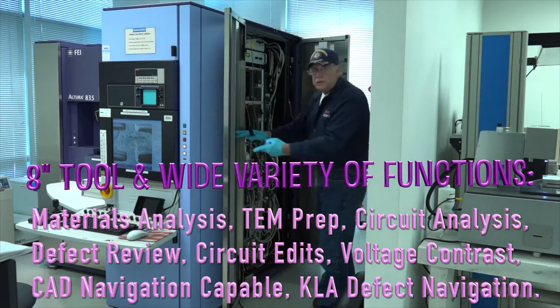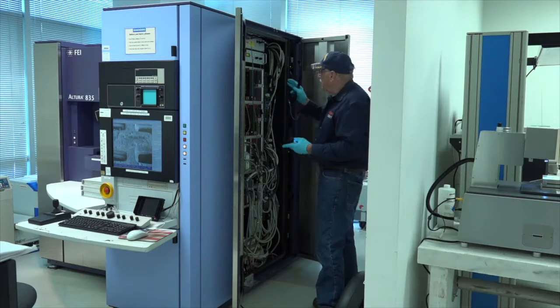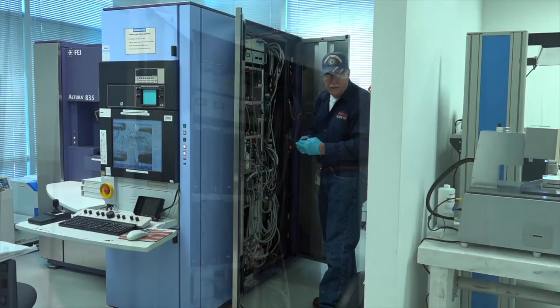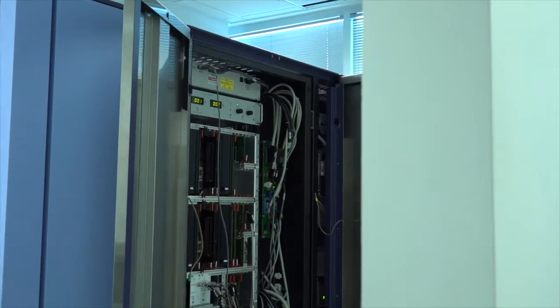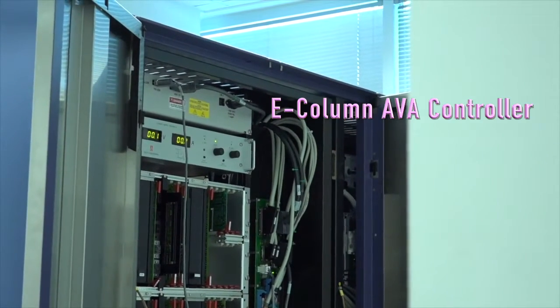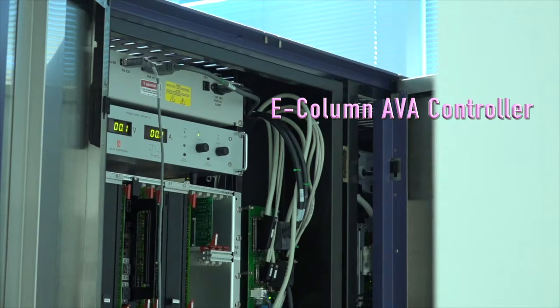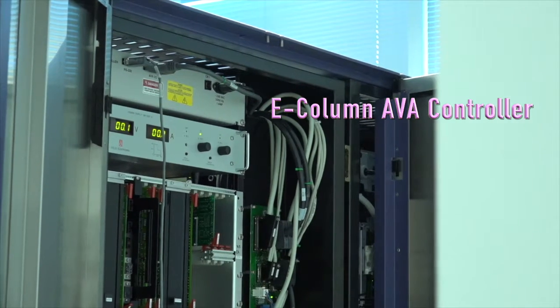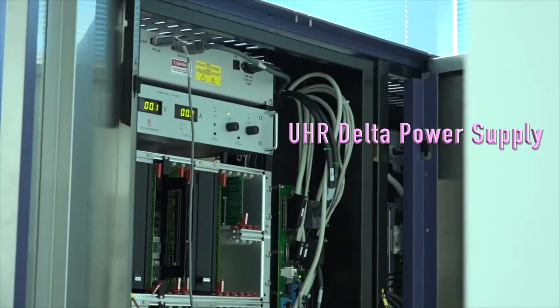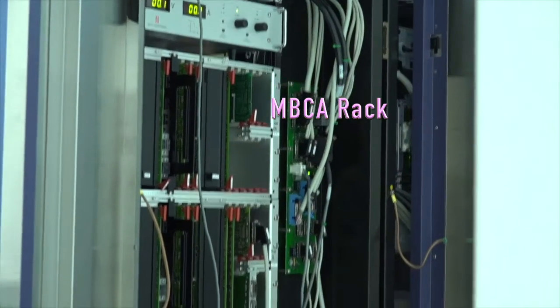Okay, and that exposes the electronics. This is the electronics rack, and I'm going to try and get a little tighter shot so you can see it a little better. At the very top of the rack is what we call the AVA controller. That's the box that controls the aperture strip in the E column. Right below that is a UHR Delta power supply. And then we have multiple electronics racks below it.